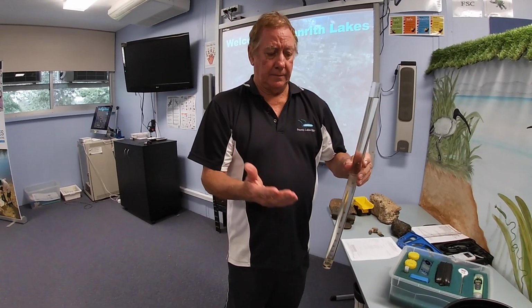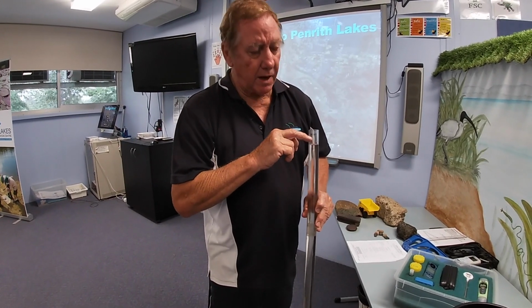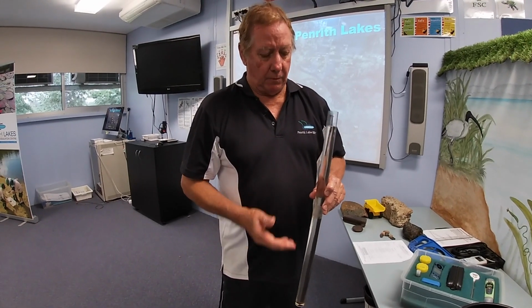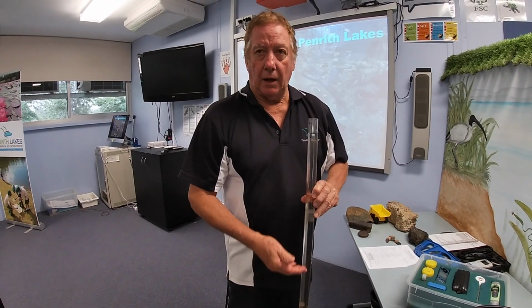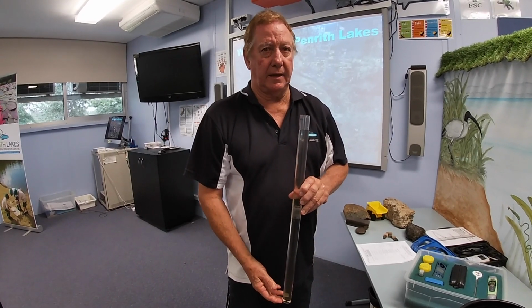I'm going to stop there because we can't, with our tube, get a better result than going higher than the 10. These numbers are going backwards, so once we go higher than the 10, we are saying it is less than 10. Now what you note about this, the lower the number you get, the clearer is the water, or the less turbid is the water. So in this case, this water has a value of less than 10 NTUs.